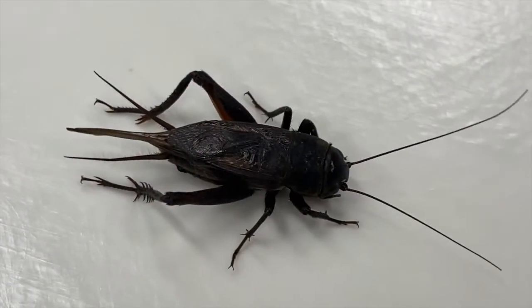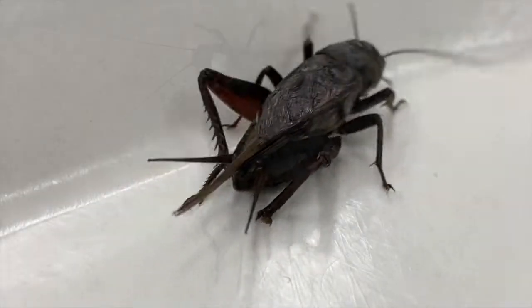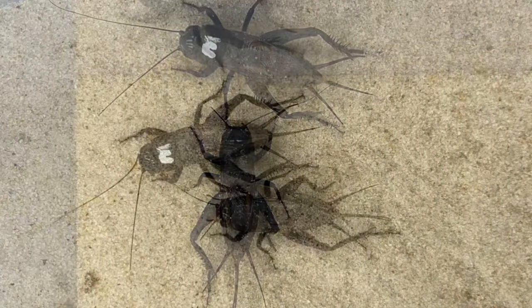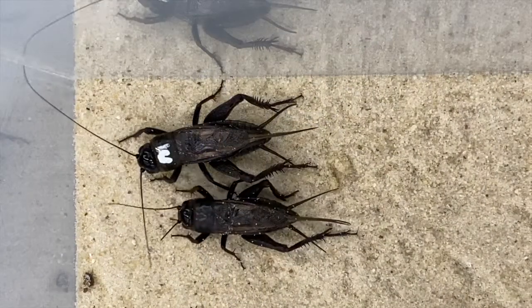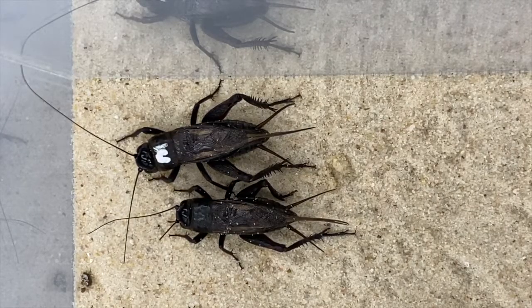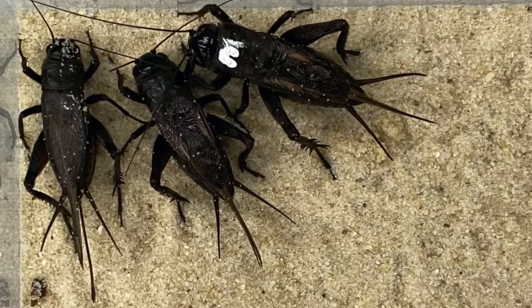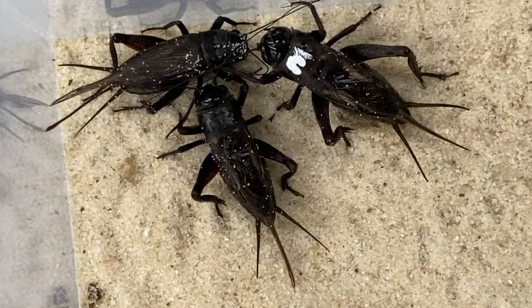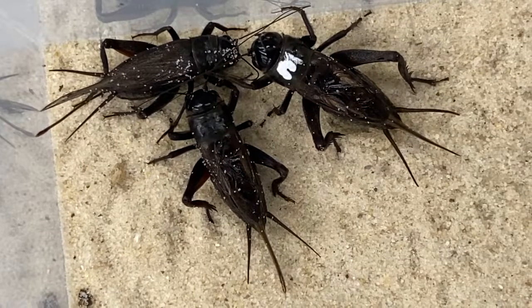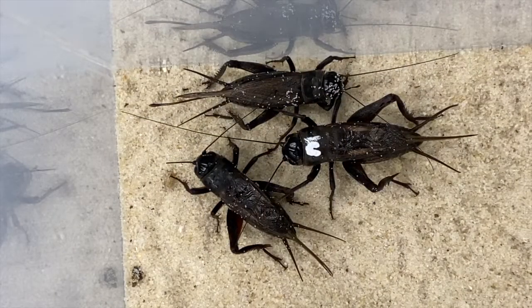In the intrasexual selection part of the lab, you will observe two male crickets, so let's take a look at them now. The larger male has the white mark on his thorax — can you see the size difference? In the intersexual selection part of the lab, the same two males will be joined by a female. Here is the larger male, the smaller male, and the female all together. Can you distinguish between them? You will need to be able to tell them apart to make your observations.